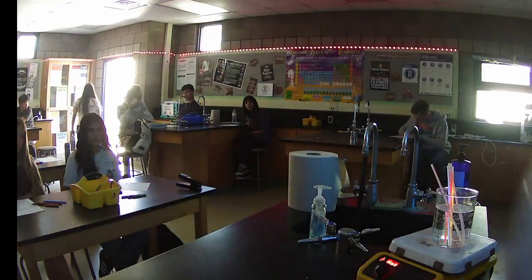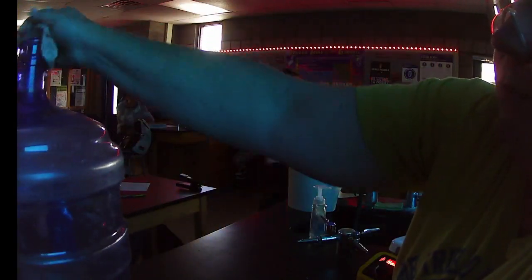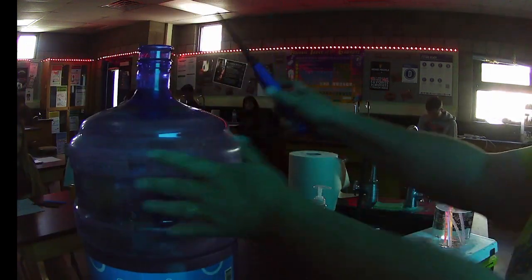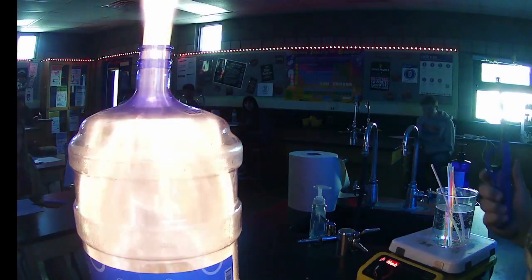And then when I shake it, it spreads. And then we're going to do the same thing. Let's see what we can do here.